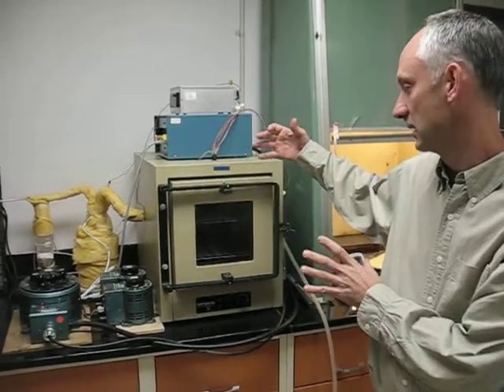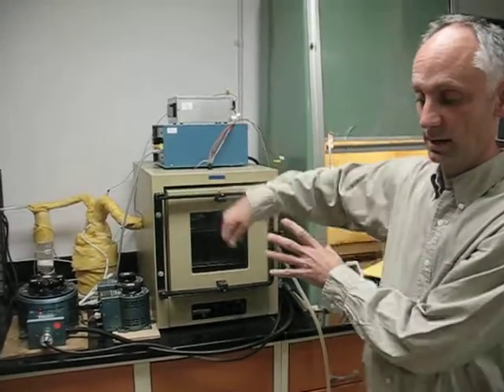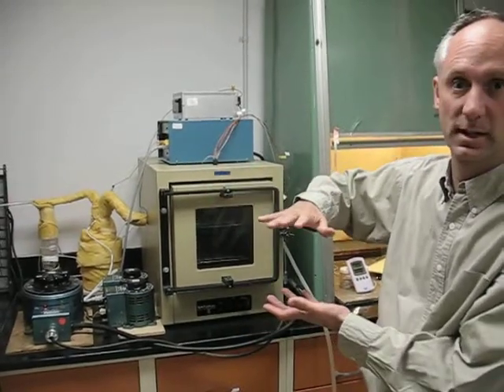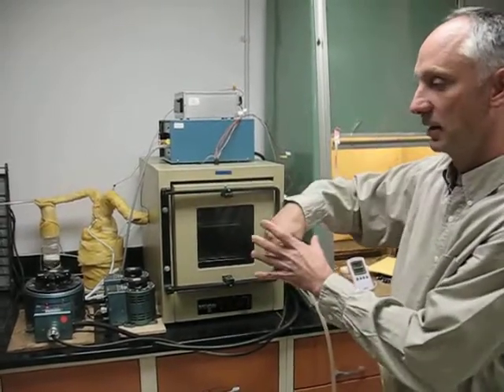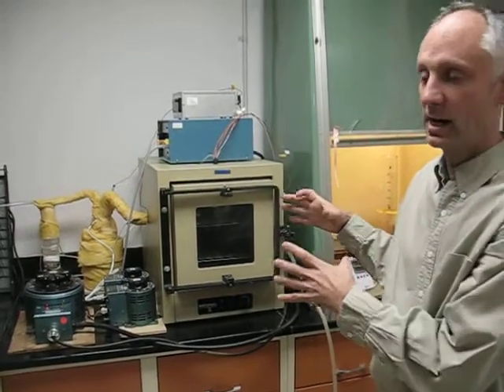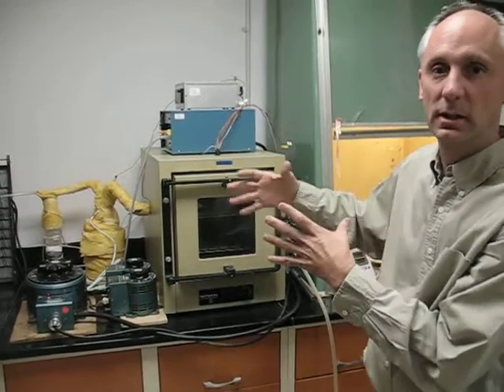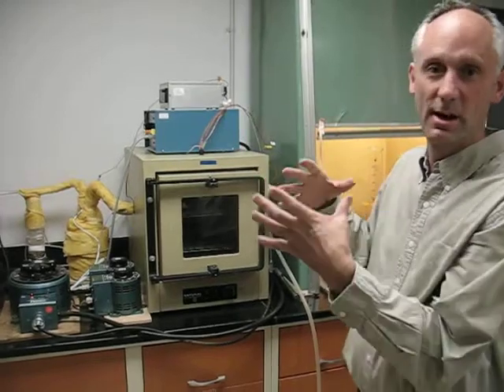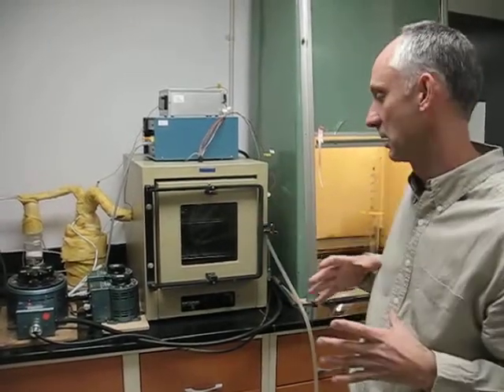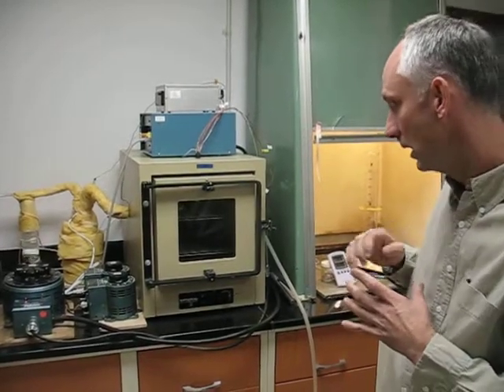We verified this by measuring air temperature in various locations, and a surrogate of samples, we used fairly coarse sand, placed thermocouples in that, and those are actually far less, as you would expect, less variable in temperature during time than the air is because of the thermal mass of them. So the samples are going to be more stable even than the air in terms of temperature fluctuation.